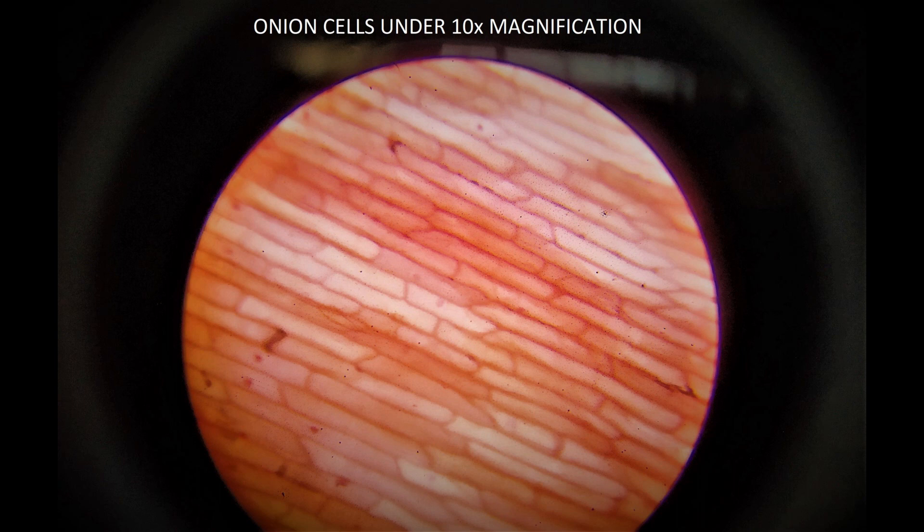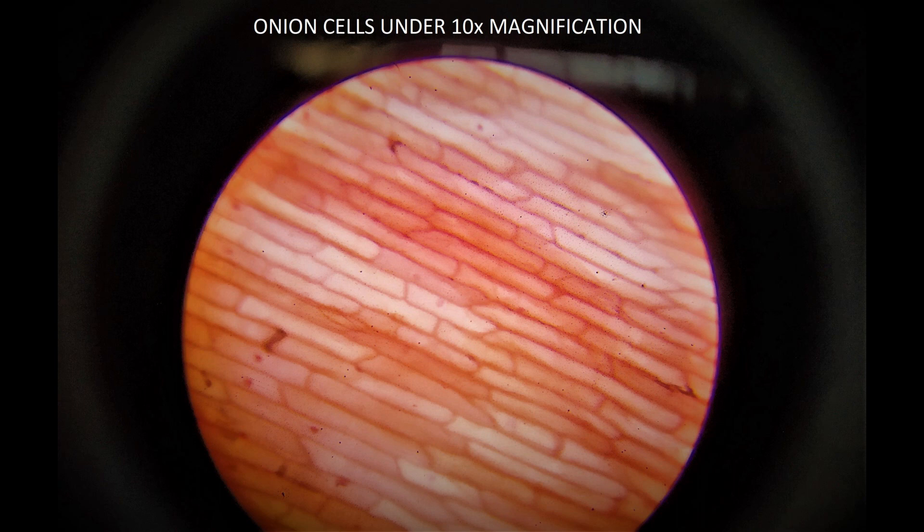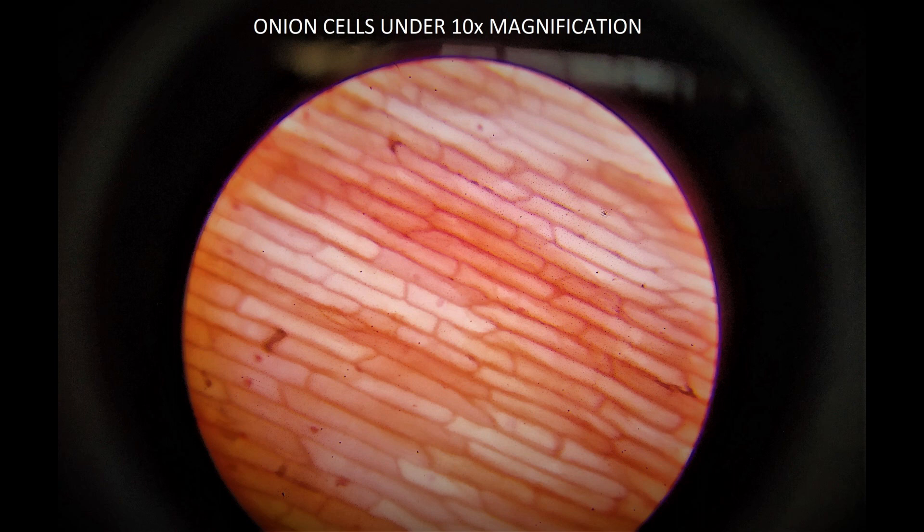Here you can see some snaps that I have taken from my cell phone. Under the 10x objective lens, there are many onion epidermal cells present. You can see there are groups of cells that connect to each other, and they do not have any intercellular space.